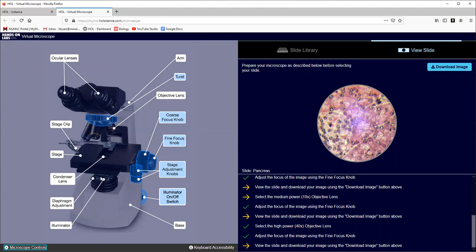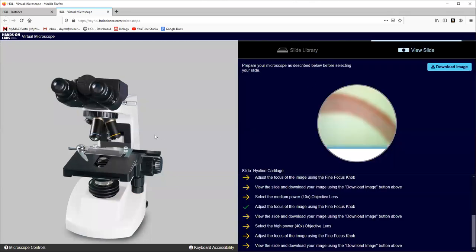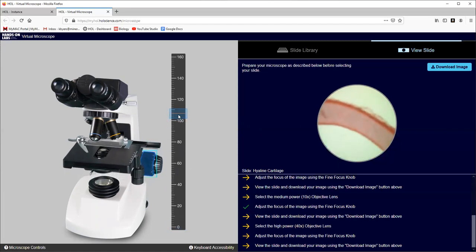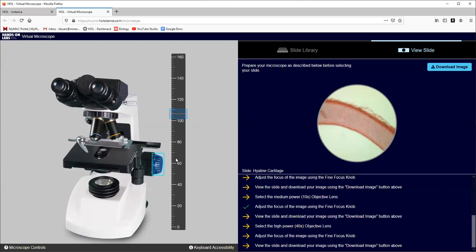And underneath, if we were in the classroom, these little knobs down here with the light could be adjusted to let more light in or less light in to make it brighter or darker. That would be necessary, especially if we were looking at living specimens or clear specimens that were unstained. We can download it or choose a different slide, whatever we need to do. If we choose a different slide, we have to start back and move our coarse adjustment again, just like we would before. And then we can choose the fine adjustment until we get it just right.